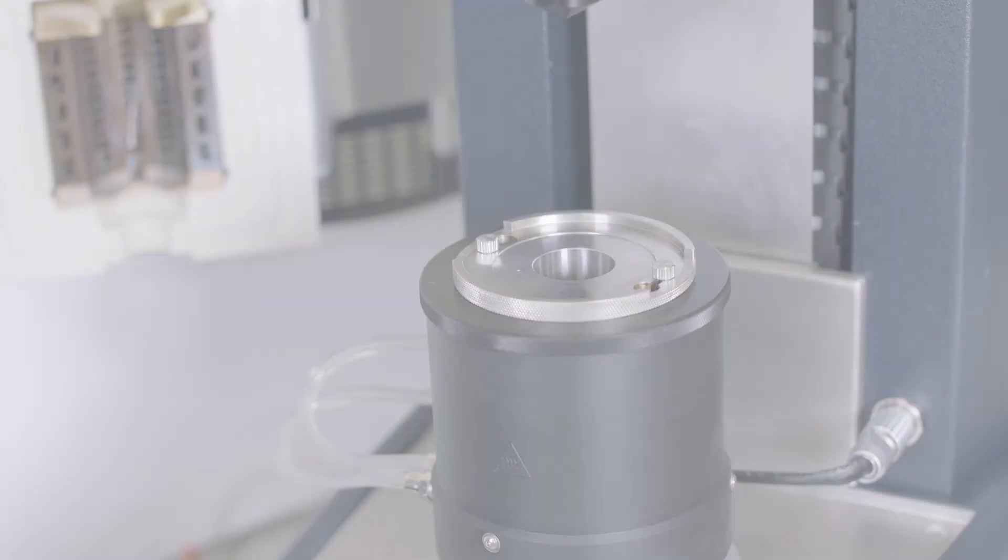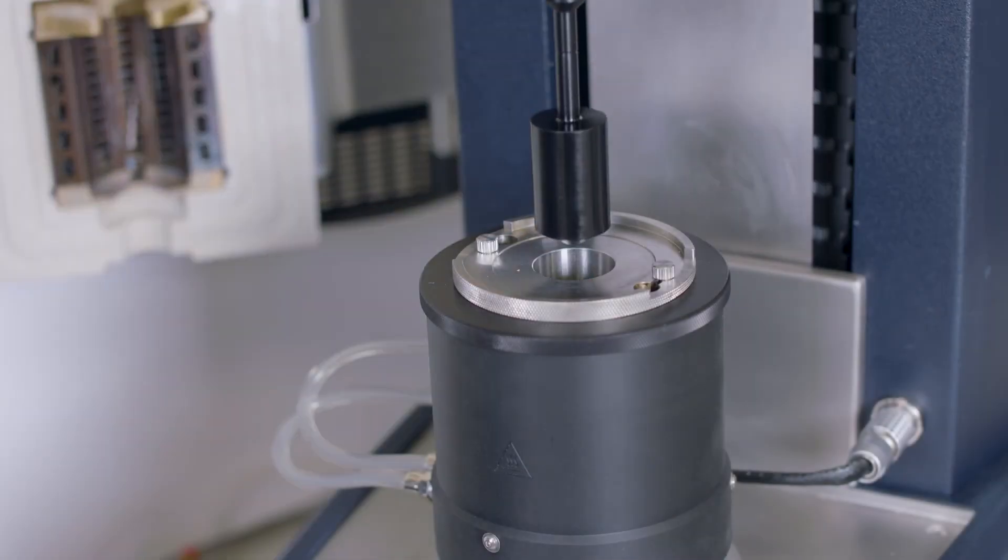The instrument is now ready for experiment design, sample loading, and test execution.